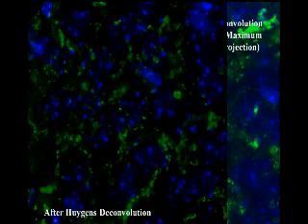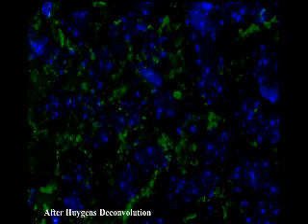So here's another example. Before deconvolution, you can see that there is a lot of extreme brightness and a lot of haze and fog. And after we run deconvolution, you can see that a number of that haze has now been removed from the image itself, producing a much crisper image.